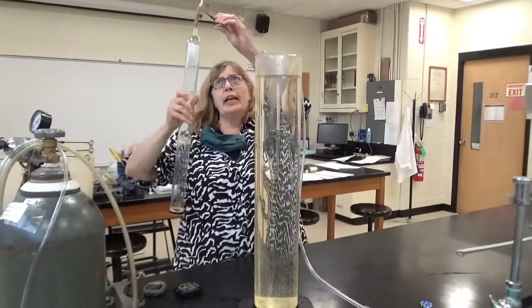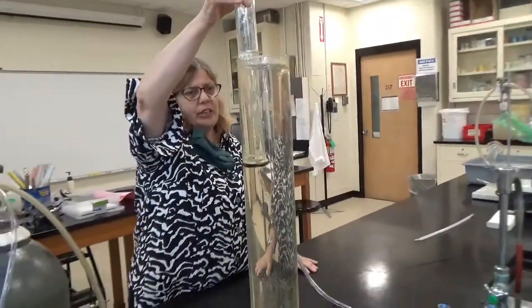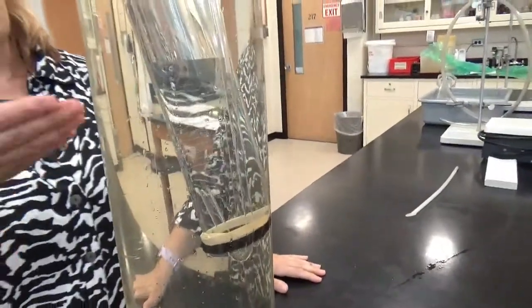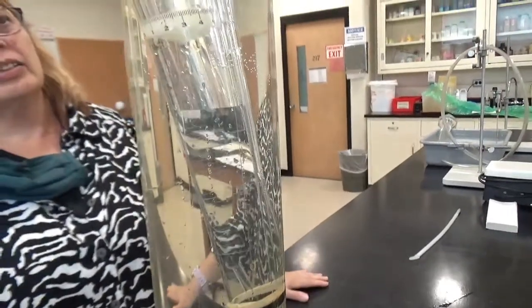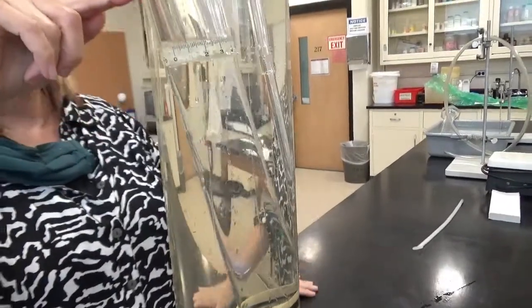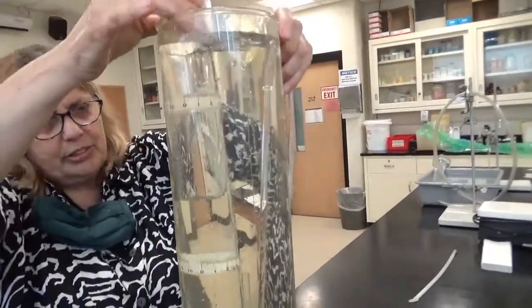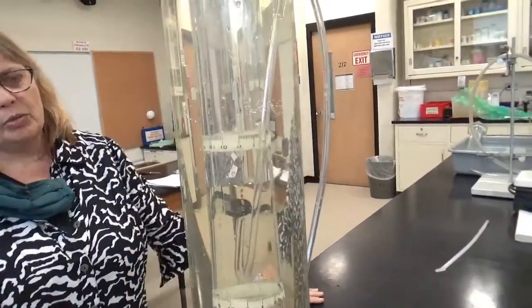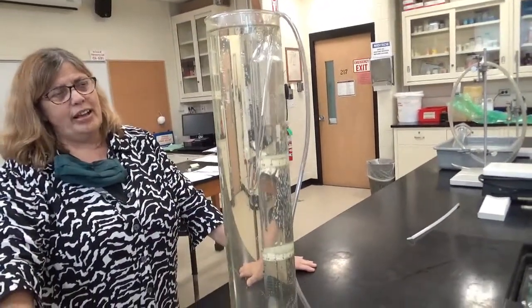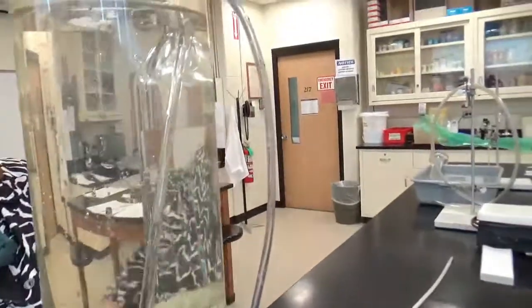Okay, so I took off the clamp, so now the air inside can get outside. I'm going to put it in this very tall graduated cylinder, and you can see the water level is rising in the tube. What's happening there, of course, is that this air is pushing through the little opening on the top. The timing we will be doing, basically we'll start timing right there, the bottom of the first tape, and we'll stop at the bottom of the second tape. Right now it was hooked on something, so it wasn't even moving that fast, but when we do it, we won't have it hooked on anything. So this is basically air flowing through this weird apparatus. And once it gets all the way through, I'm going to clamp the top.